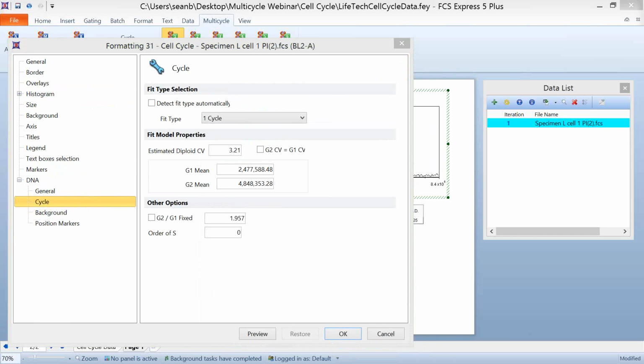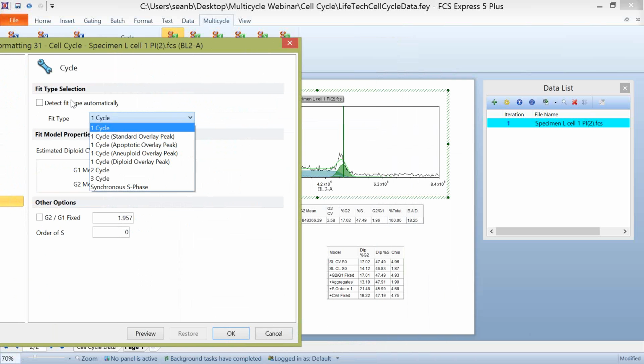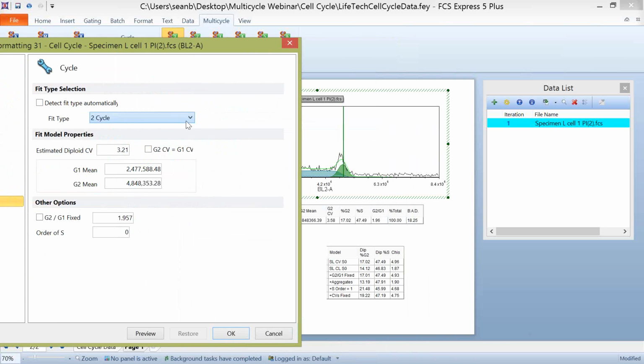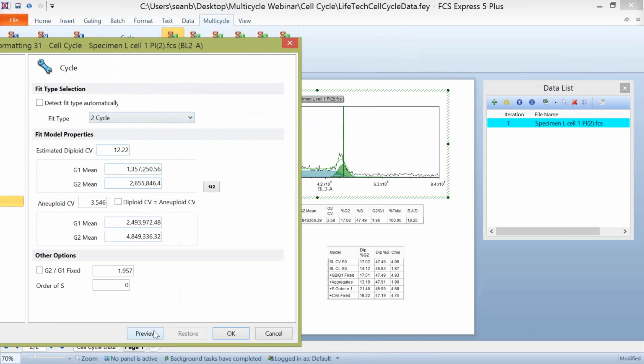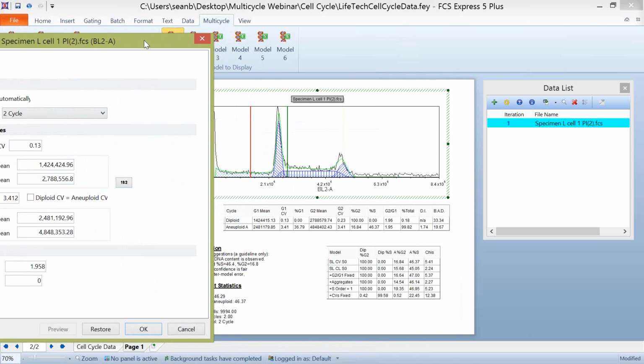This is a very important and very powerful tool to be aware of. Besides just changing our fit types, which we can do from here, if we wanted to take this off of the automatic mode and see what a 2-cycle fit looks like for our data, we can simply choose 2-cycle and click preview. And we can see what a 2-cycle fit would look like for that data. Of course, in this case, a 2-cycle fit isn't appropriate. The 1-cycle fit that was determined would be the best.